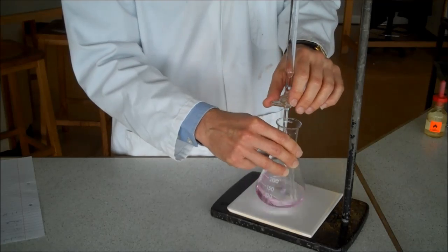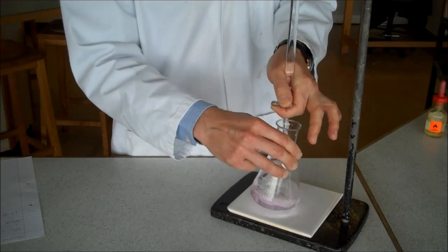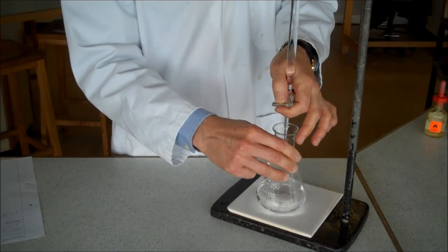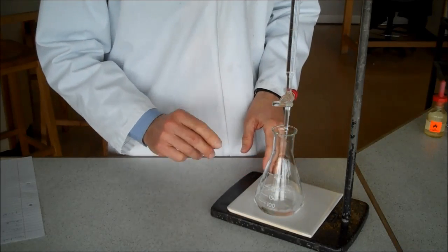It's ever so slightly pink. You wouldn't be able to see that against the dark background of this clamp stand. One last drop, and it's gone completely colourless again. Remember what I said, colourless, not clear.